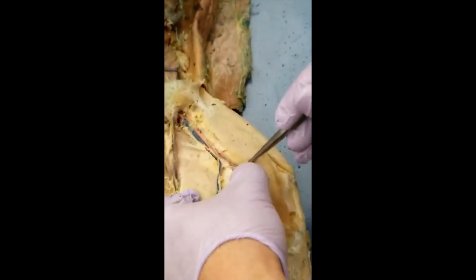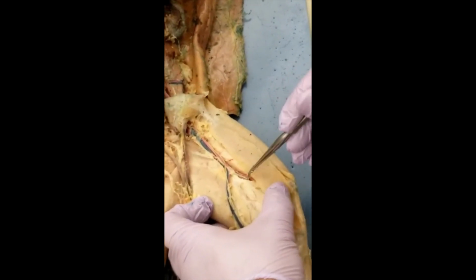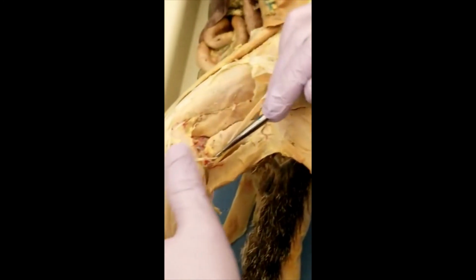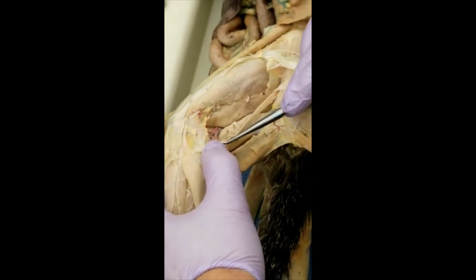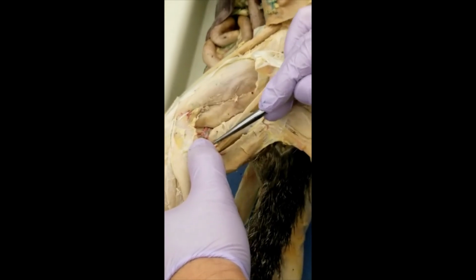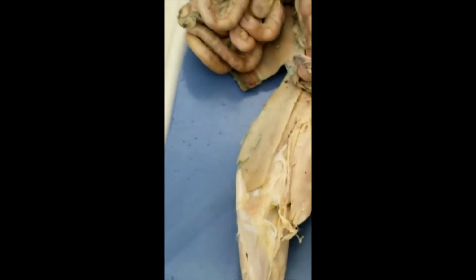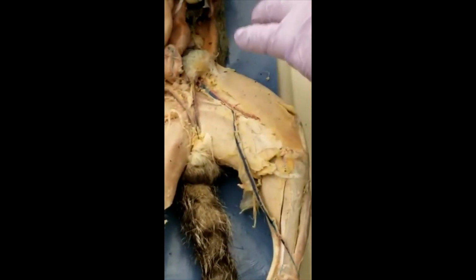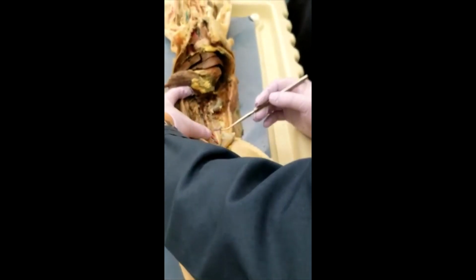It comes from here. That's popliteal, and this is muscularis. So the popliteal comes out from here. That's still popliteal, and you can see the branch: posterior tibial and anterior tibial. So that's all the arteries and the veins below the diaphragm. It's the same location. You see that? It's all side by side. And so you should have no problem.